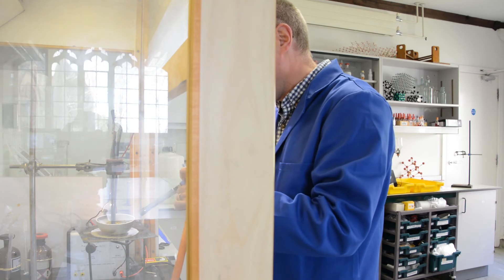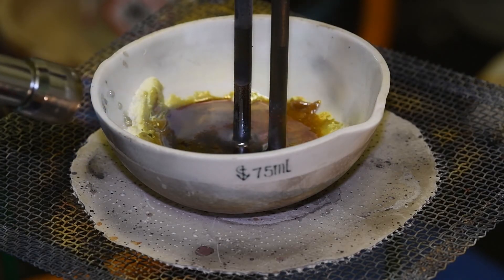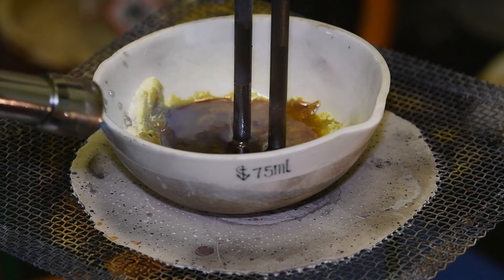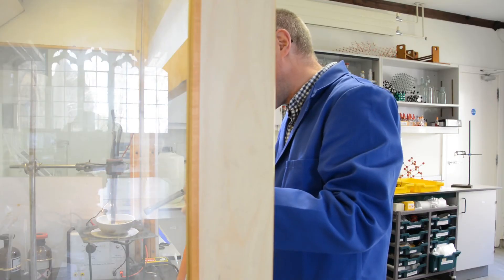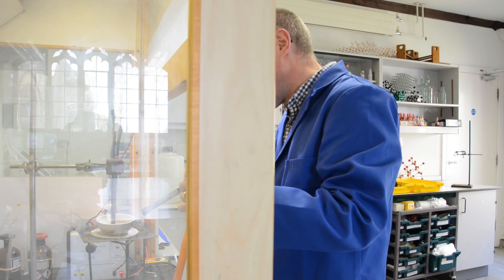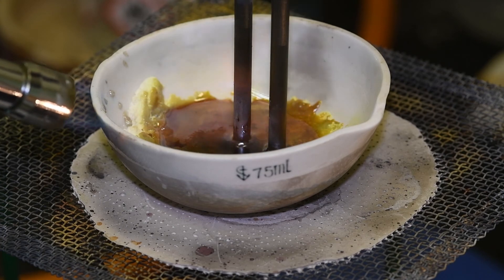And if you look very carefully at the positive electrode, the anode, which is the electrode here, if you look very carefully you'll be able to see that there are some bubbles around that electrode. Those bubbles of bromine gas.